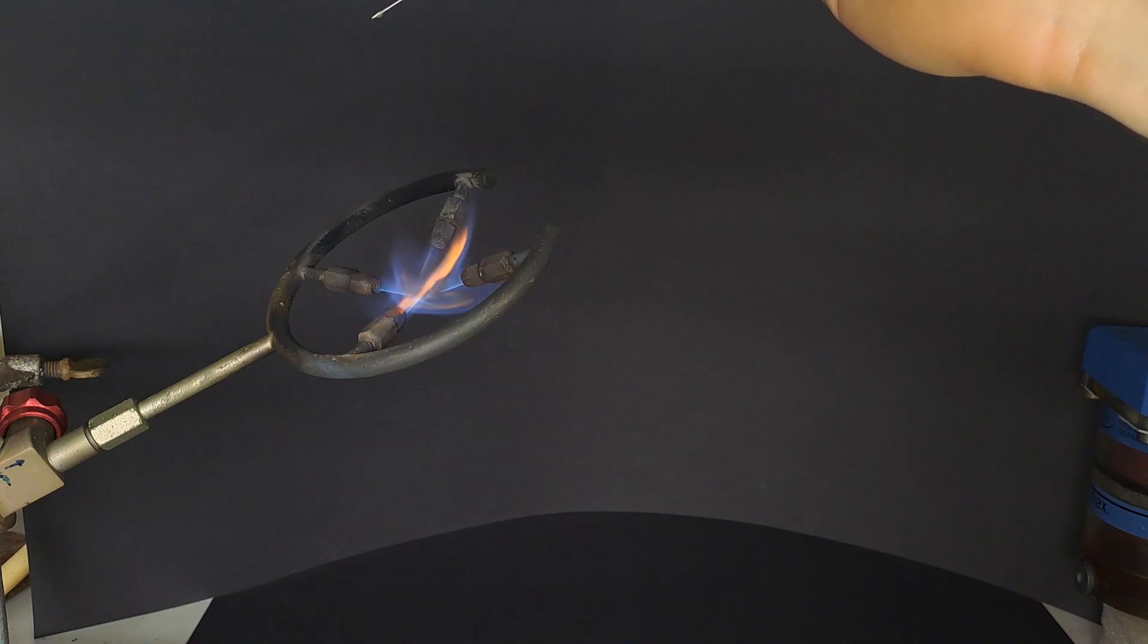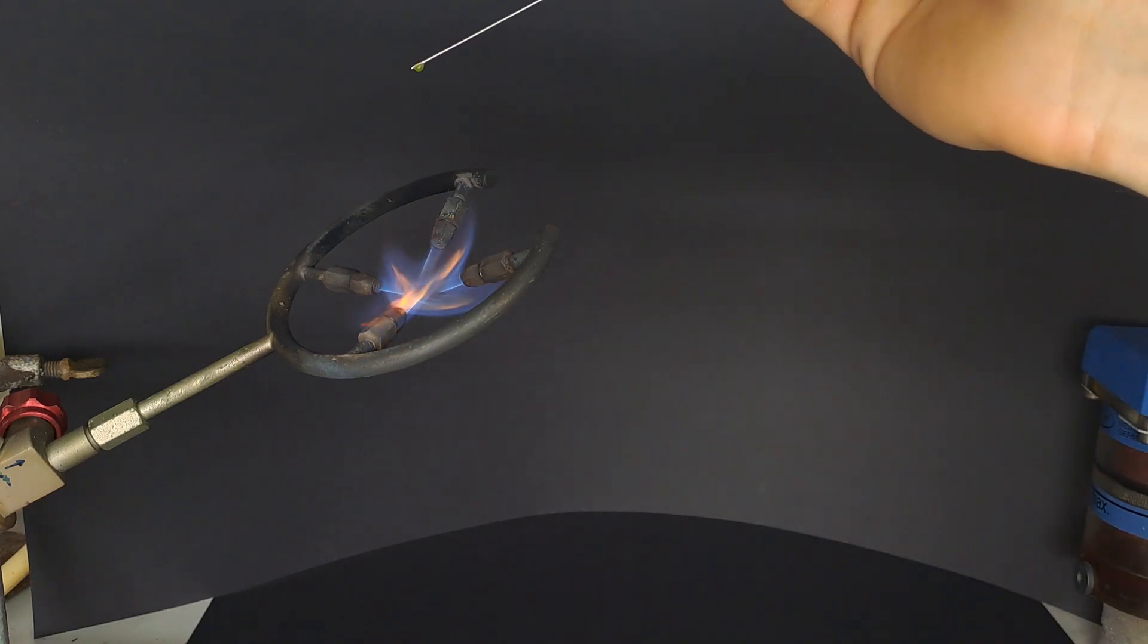First, I wanted to test if we can simply drop the substance onto it. The flame is so hot that I expected the drop to evaporate immediately, but there was a failure.